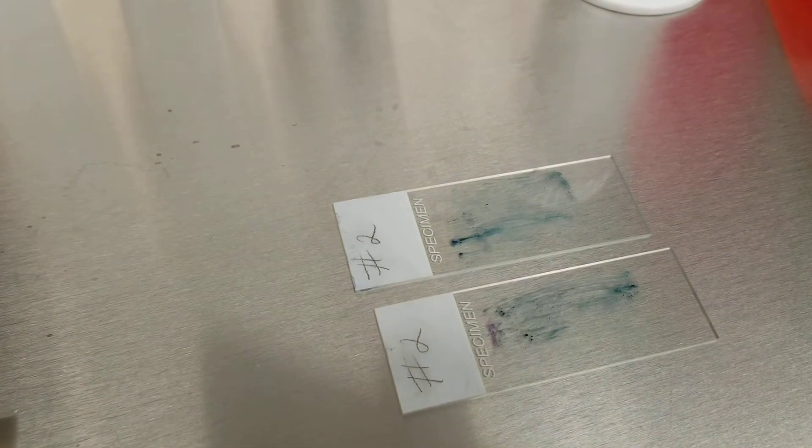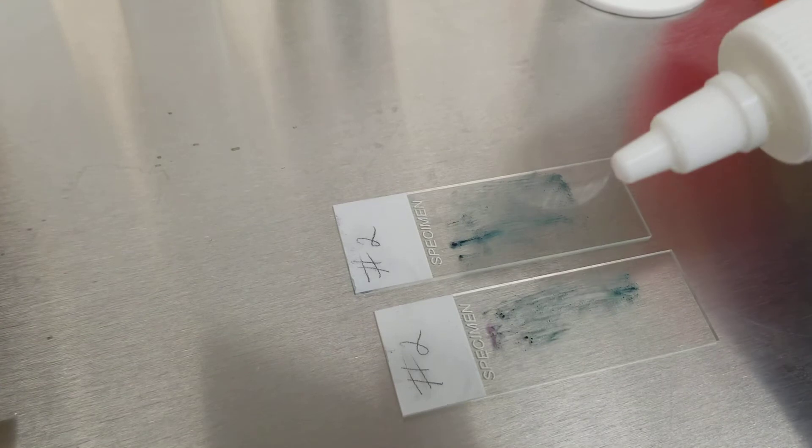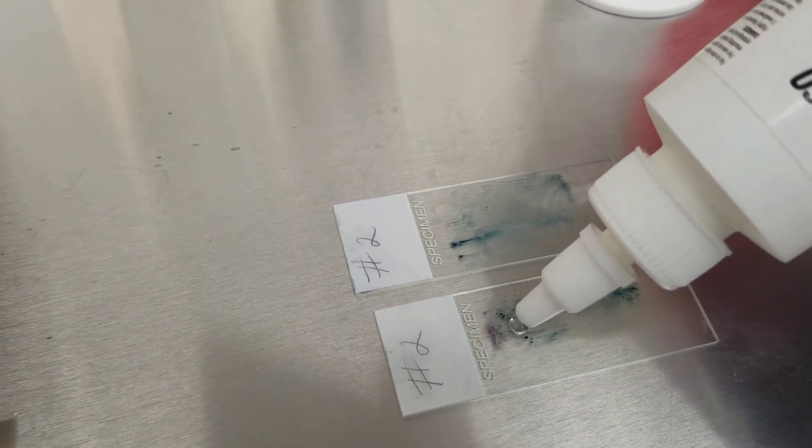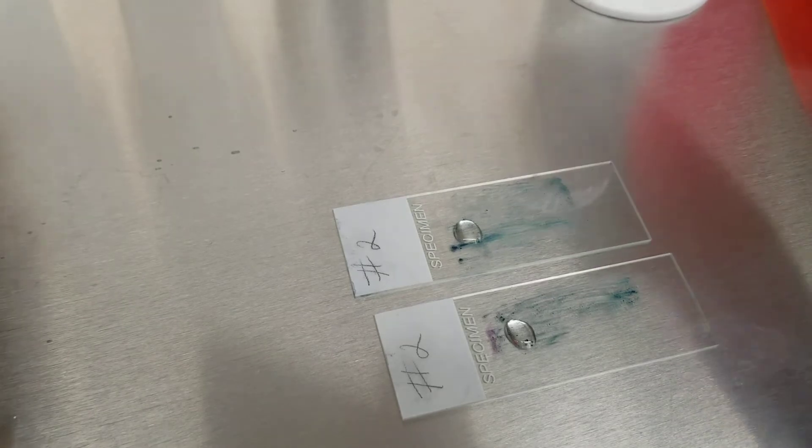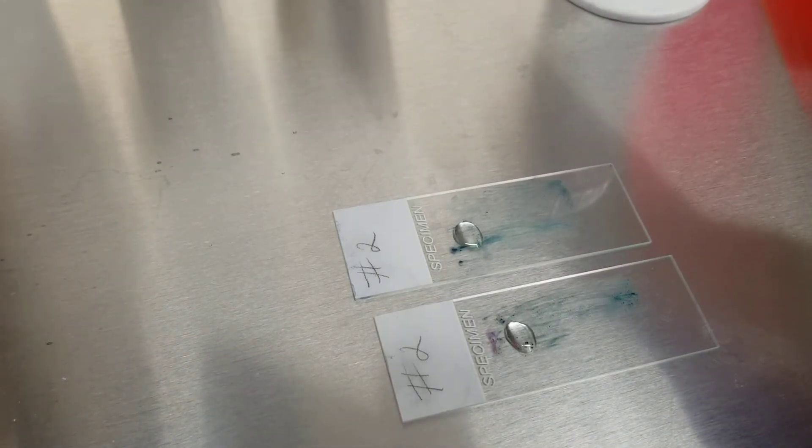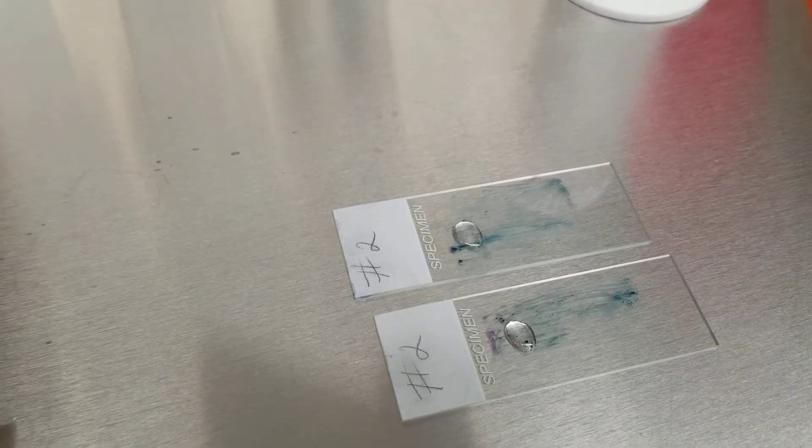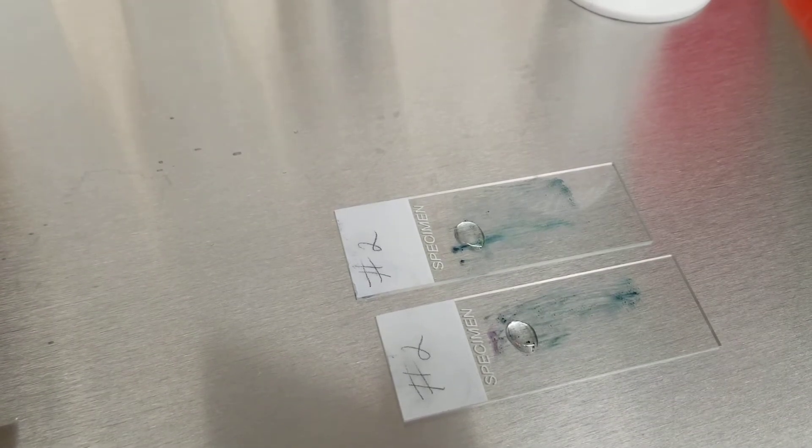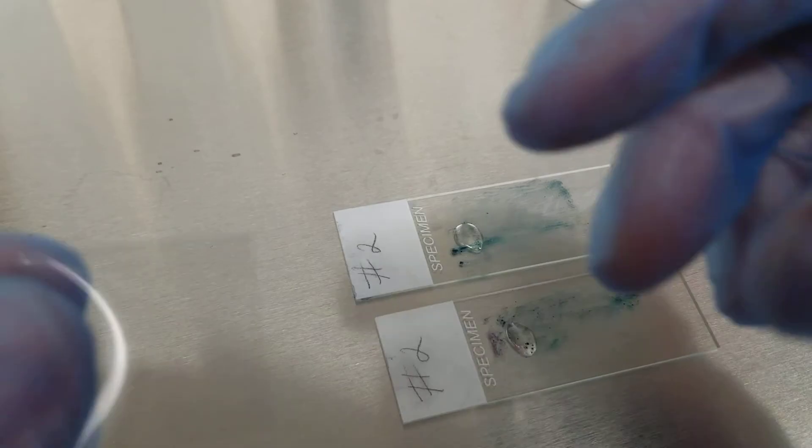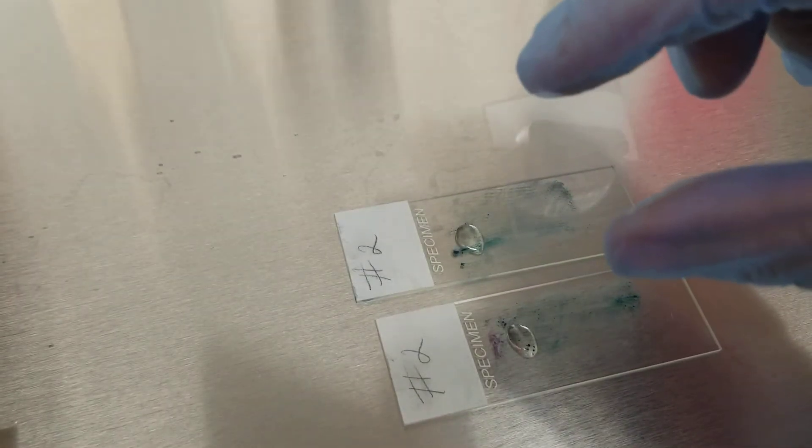I don't have the right size coverslips, so don't laugh at me. You should be using a number one thickness and the ones we have do not cover the entire area. So I'm getting a clean coverslip. See, it's too small.